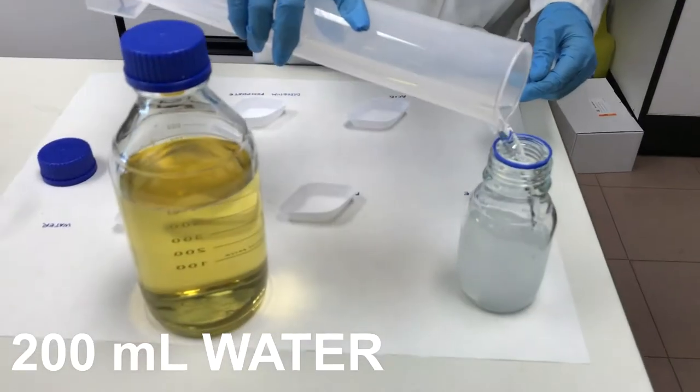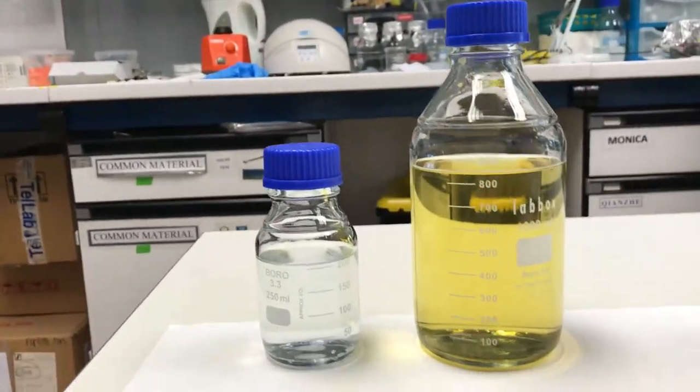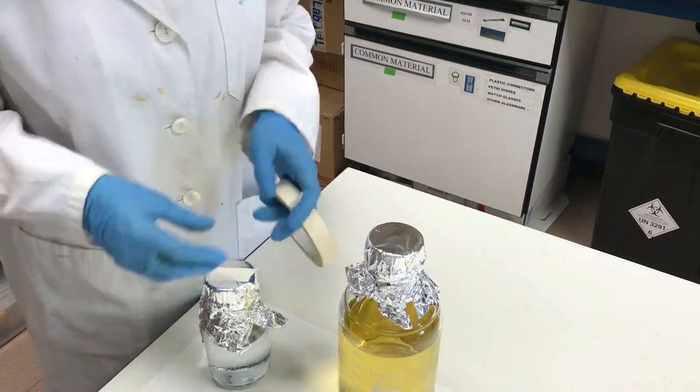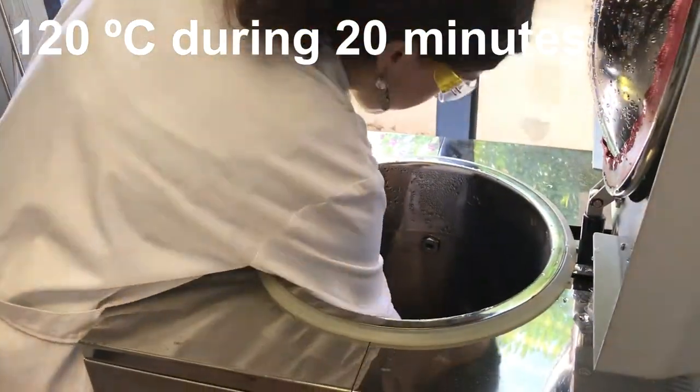We sterilize the culture media in an autoclave to avoid possible contamination during growth, and separately to avoid undesired reactions between sugar and amino acids.